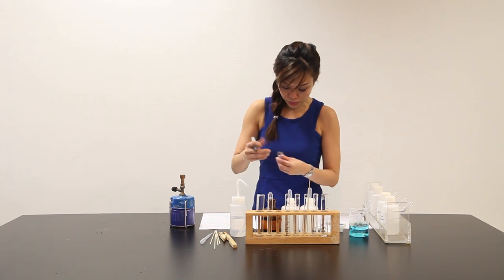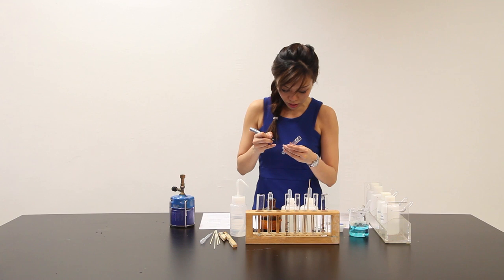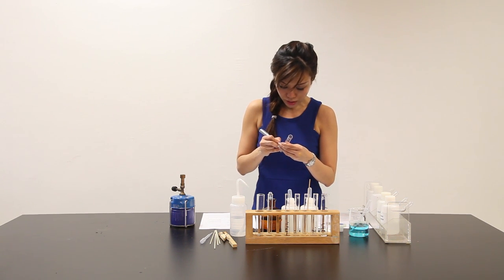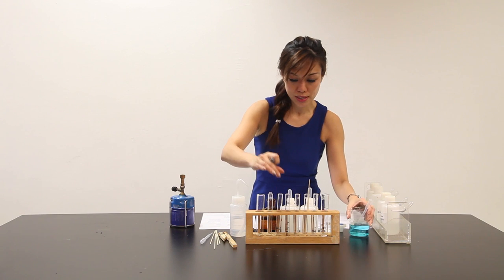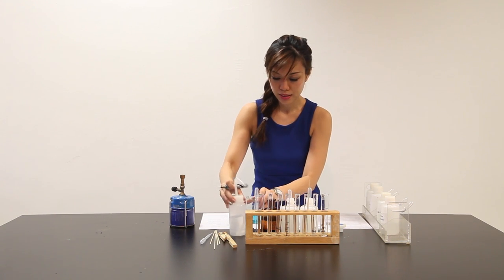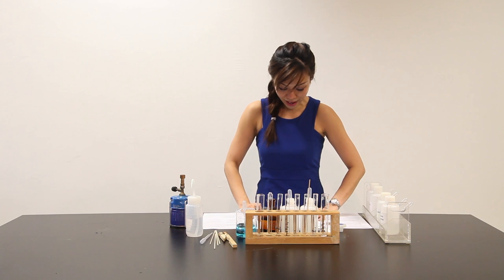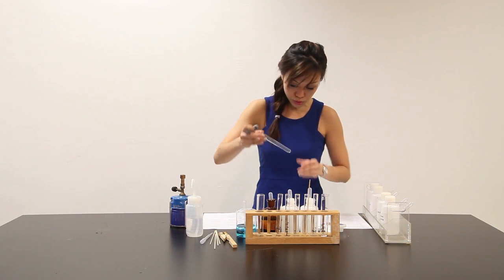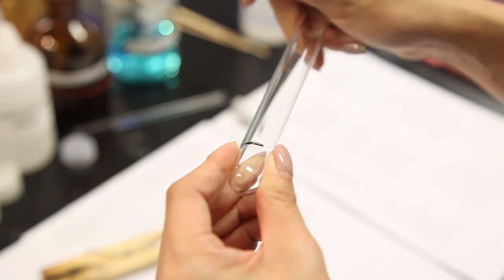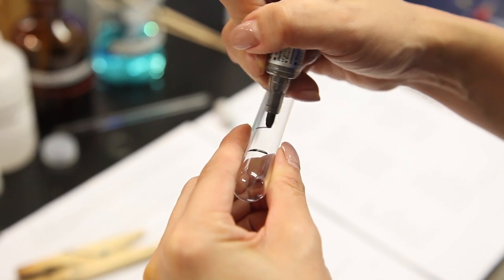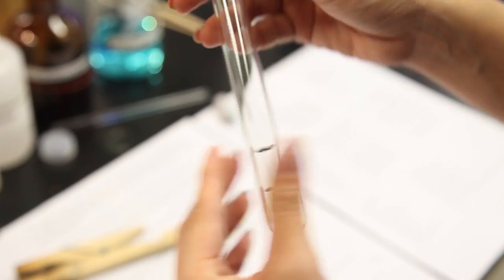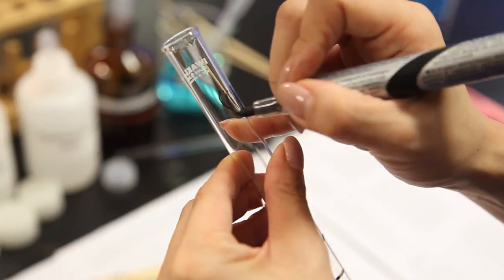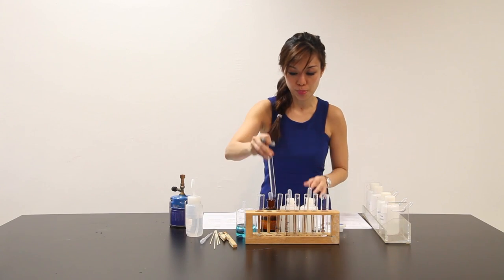So, 2 cm³ of Y, another 2 cm³ of solution of copper sulfate. Okay, copper sulfate is here. And then I add another 2 cm³ of hydrochloric acid. So, to another 2 cm³ of Y, I add another 2 cm³ of hydrochloric. This is the last portion of it. Alright, I finished preparing.